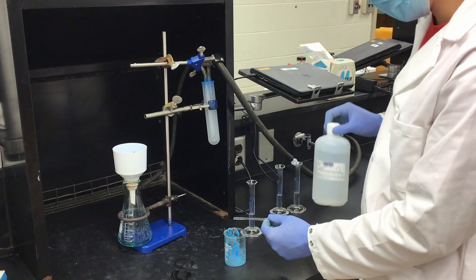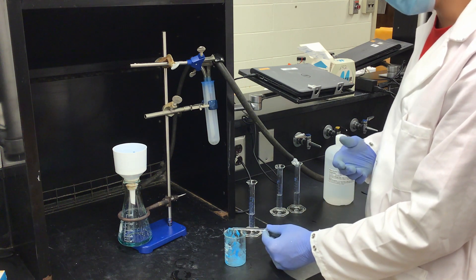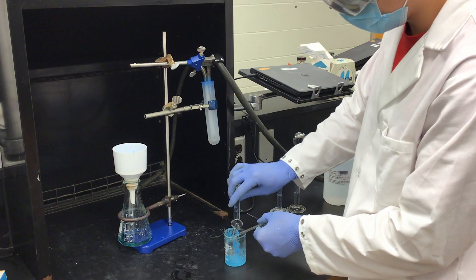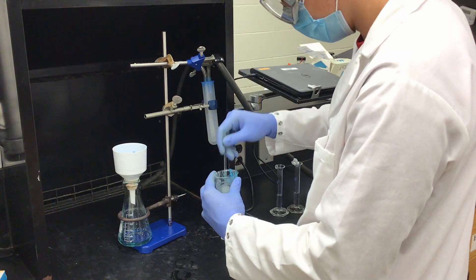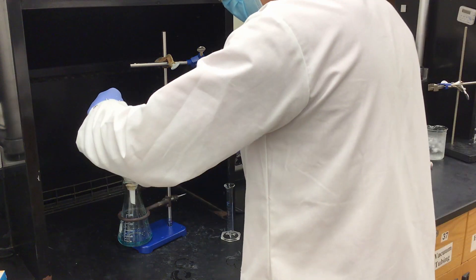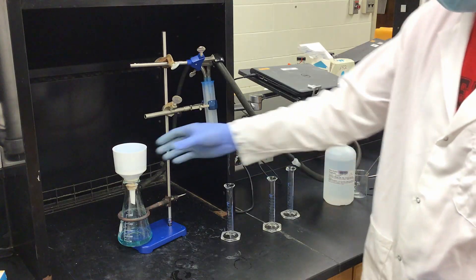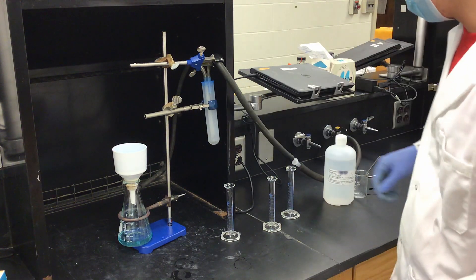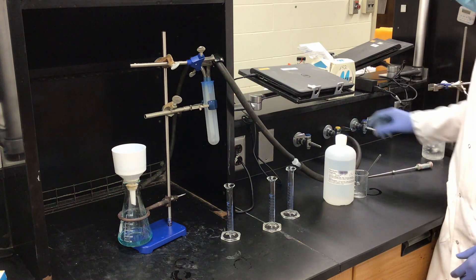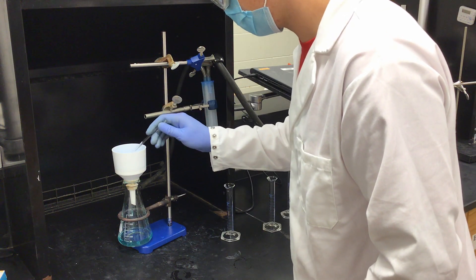I can take my 95% ethanol — I have pre-measured 5 milliliters of ethanol into each of three graduated cylinders for expediency of the recording. You will need to measure out replicates each time. These are going to be our washes. I add 5 milliliters to our beaker, swirl around the crystals, and then pour and collect. Then again another wash, and then one final wash. I have now washed my crystals and gathered them onto my filter paper inside the apparatus. I will now pull full vacuum to try and dry the crystals as much as possible, getting as much air through them as I can.